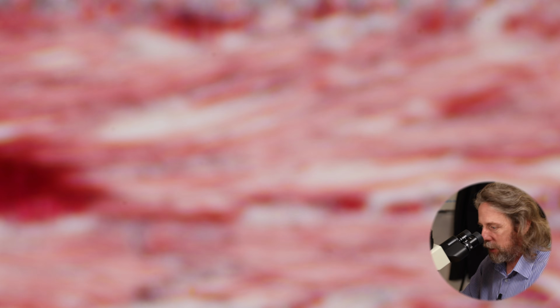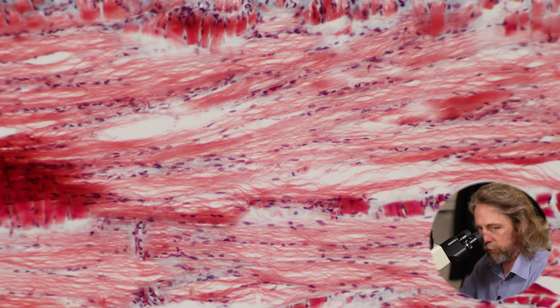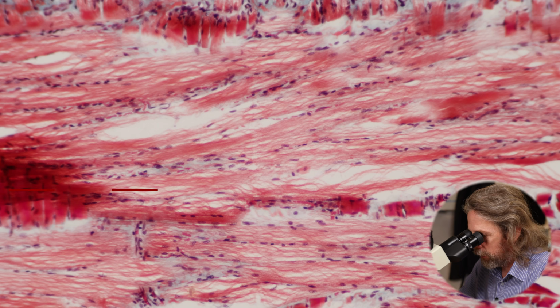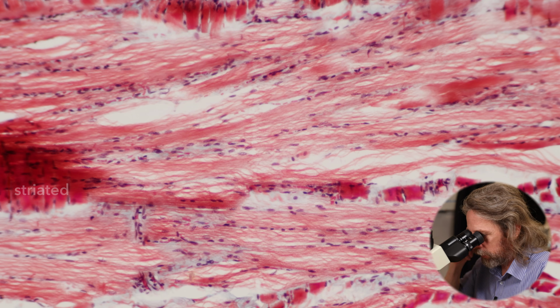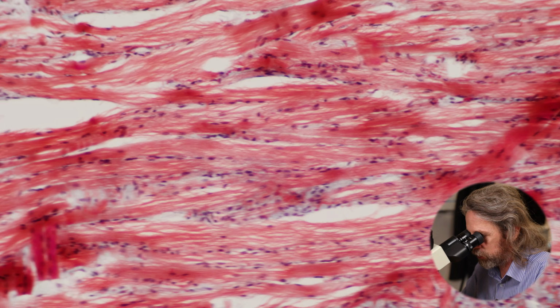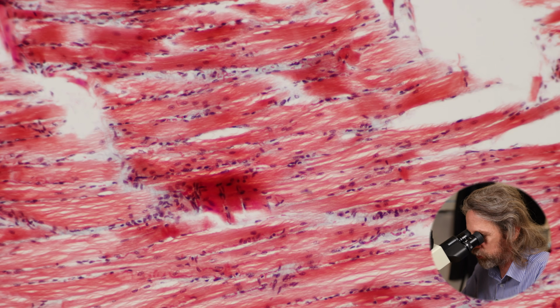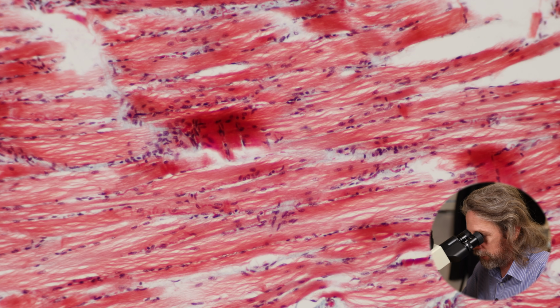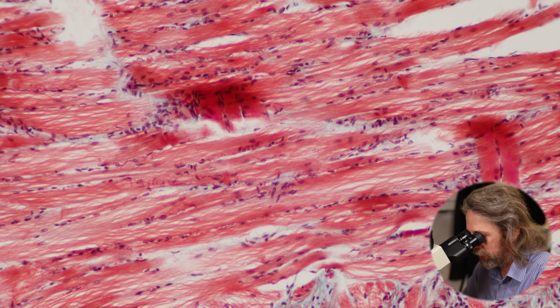Let's jump down. So skeletal muscle and cardiac muscle get lumped together as striated muscle, because if you have a good microscope and a nicely stained section and you look at it right, you can see stripes, and that's why this is such classic histology, because it's the stripes we're going to talk about. Can you see how this is muscle that's been cut longitudinally, so we're seeing the length of the muscle.